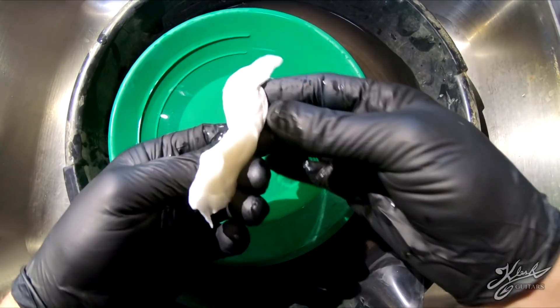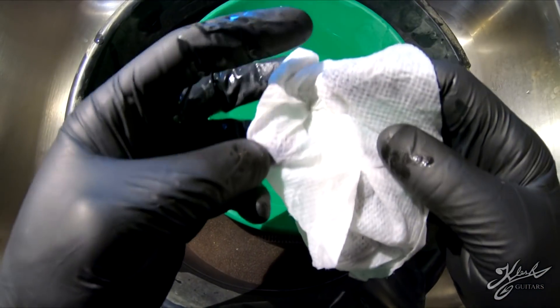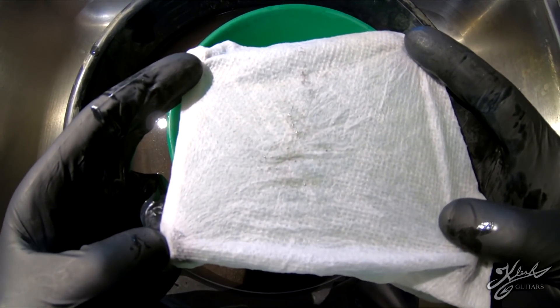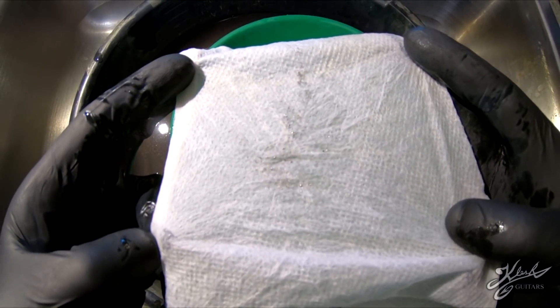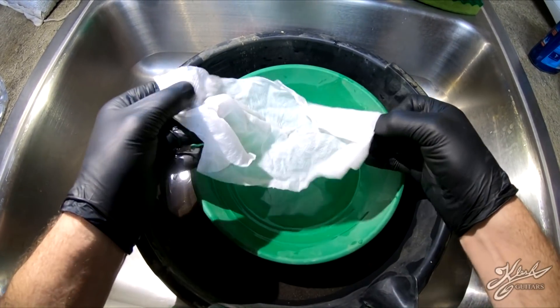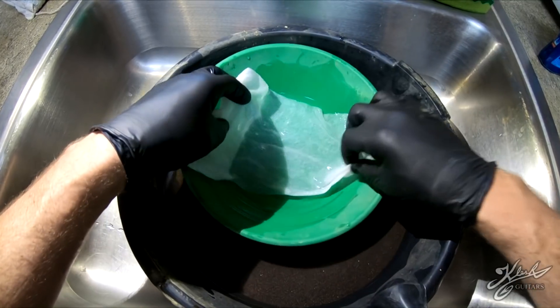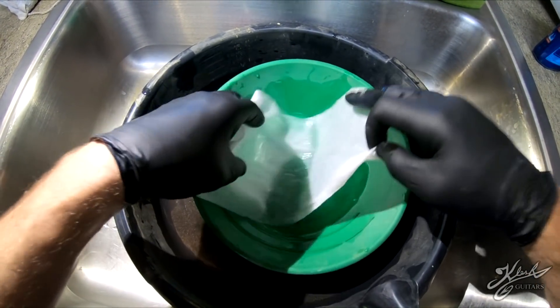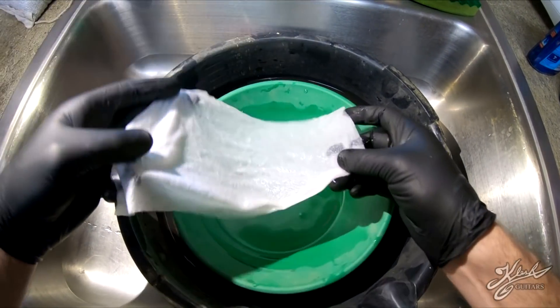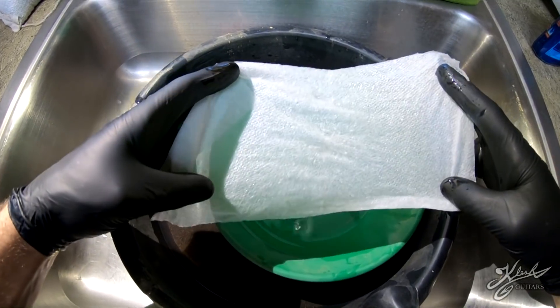What we have left is some mercury and most of our gold - it's right in here. It's not very much; it's only one pound of black sand but that's where we're going to get our gold from. The next thing we want to do is take this paper towel and flip it over inside of another clean pan to get all that gold amalgam out. This rag is still going to have some mercury on it, so put it with your waste materials going to the recycler.